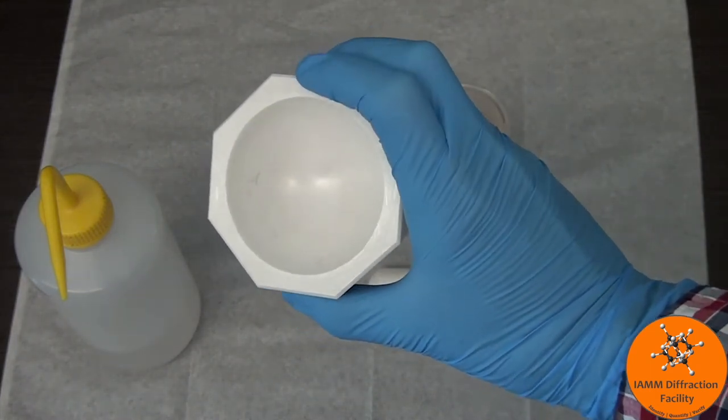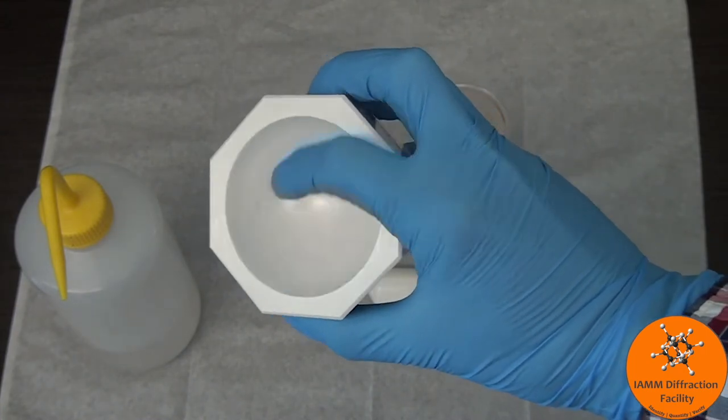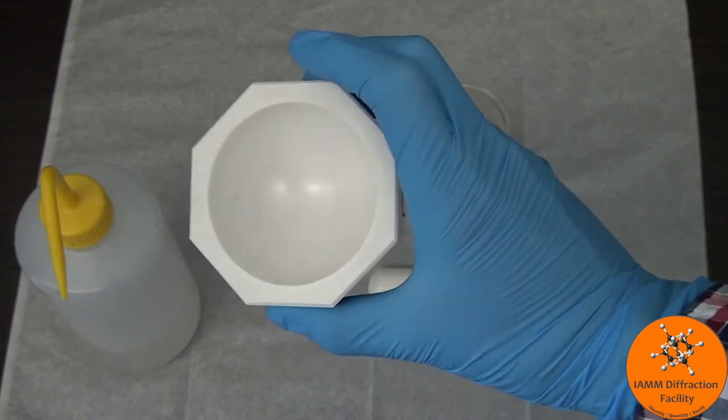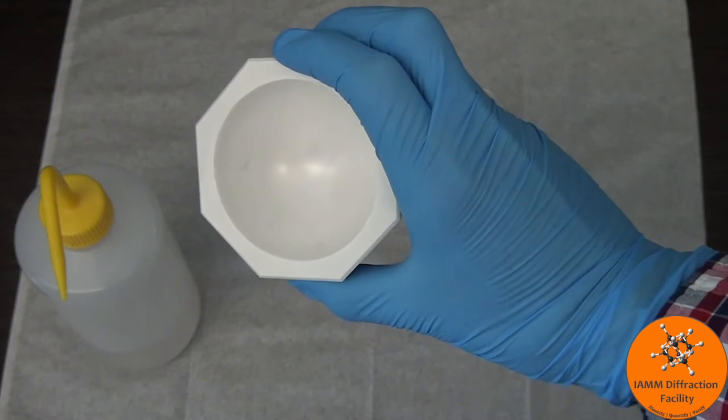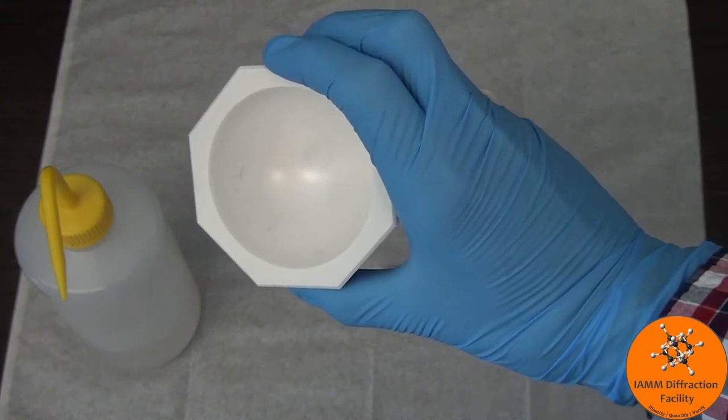It's not too dirty there, but along the edges there's still quite a bit left over. And that doesn't come off with just wiping it down with isopropanol and a chem wipe.